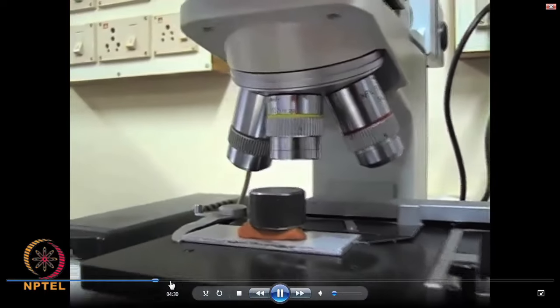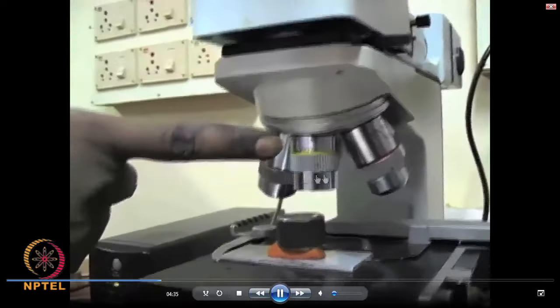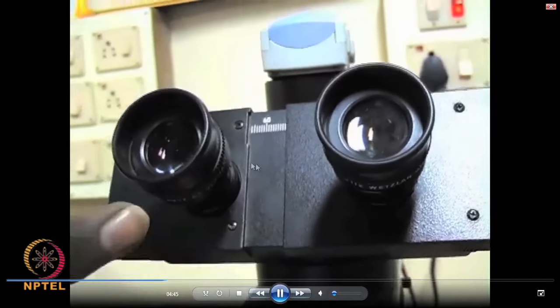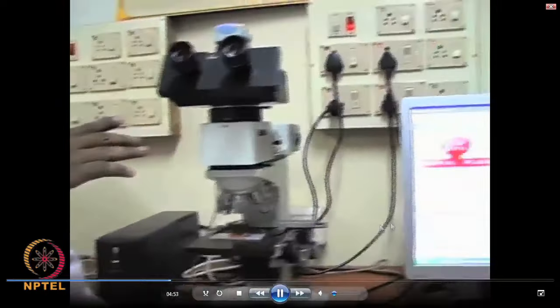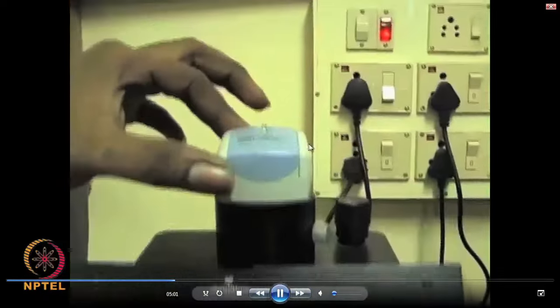This is how the specimen is placed under the objective, and then you choose the lowest one to examine the microstructure details through the eyepiece. You can directly view through the eyepiece as well as look at the computer monitor because it is interfaced with the CCD camera. Either you can look through the ocular directly or you can look at the computer monitor.